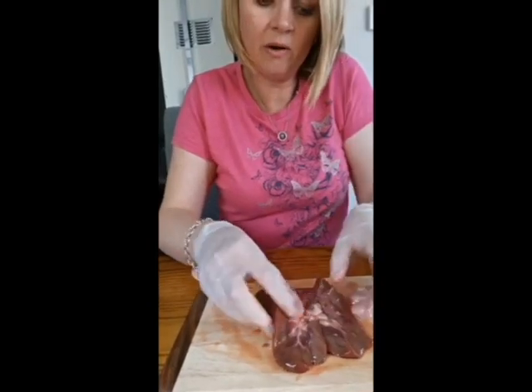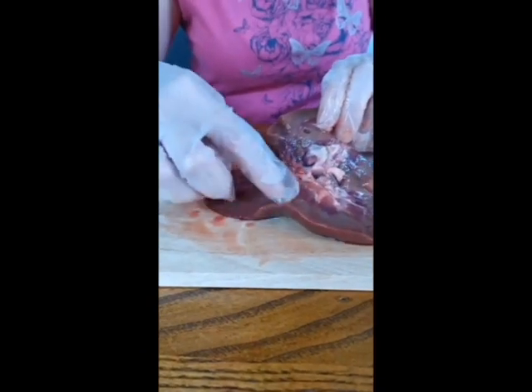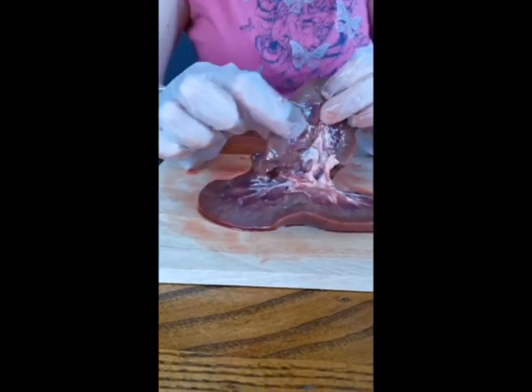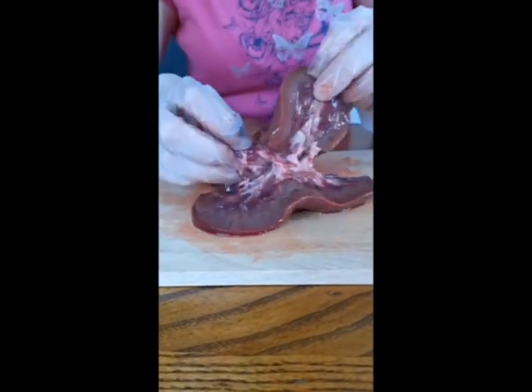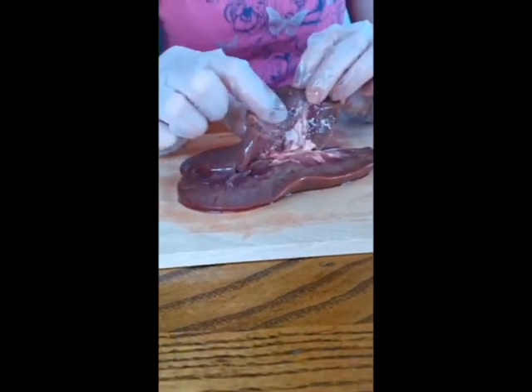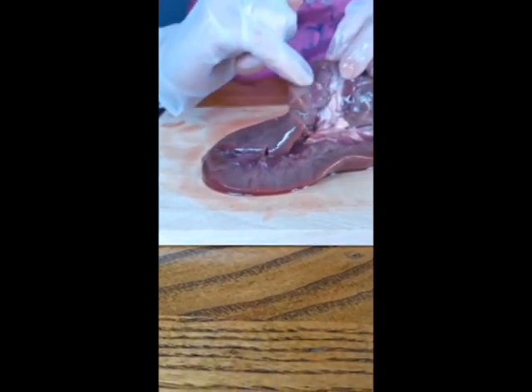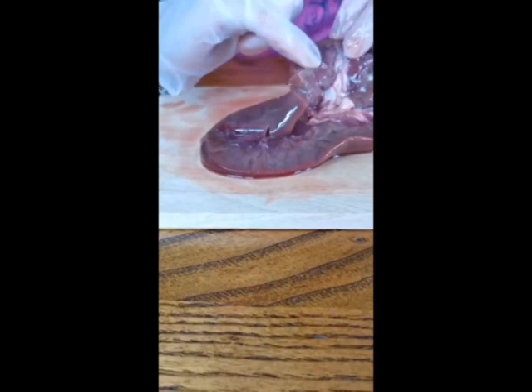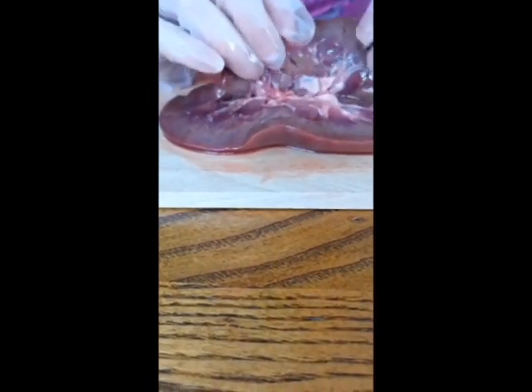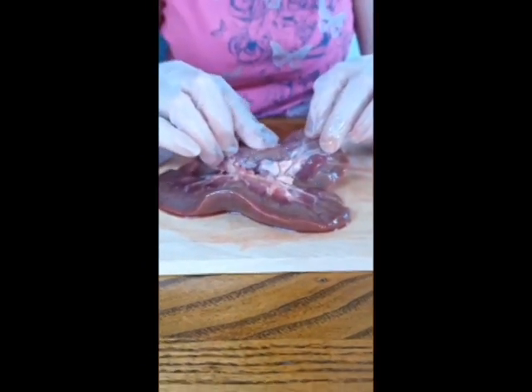Now if I open it up, you can hopefully see there's 3 different sections. Now this bit here, this sort of browner, sort of duller colour on the outer edge that you see at the top and the bottom, can you see that? It is called the cortex. Now, the blood that goes into the kidney from the renal artery will actually put the blood around here, and then that feeds into a thing called a Bowman's capsule, and the liquid part, the plasma of the blood, goes into the Bowman's capsule and then feeds down into this next layer here.